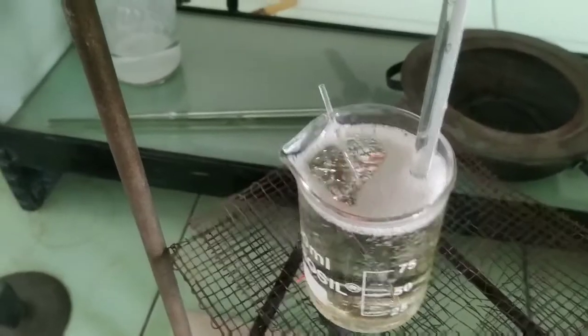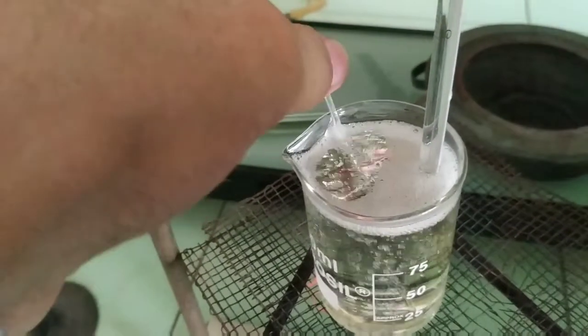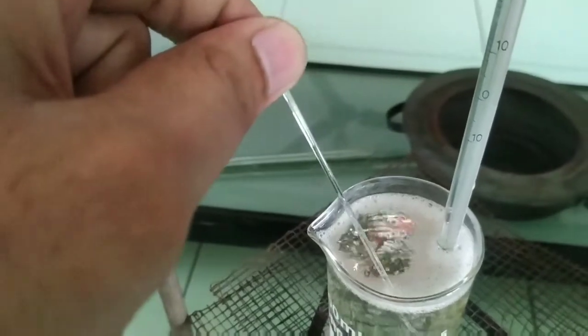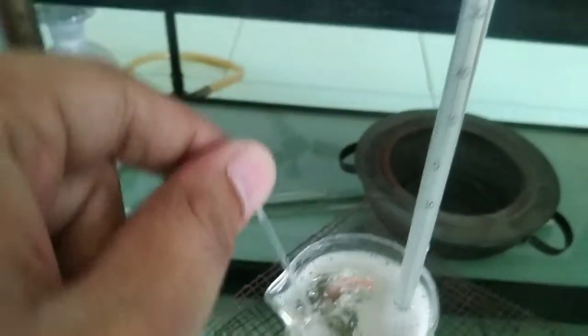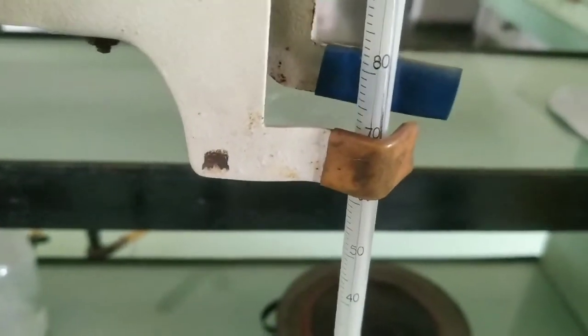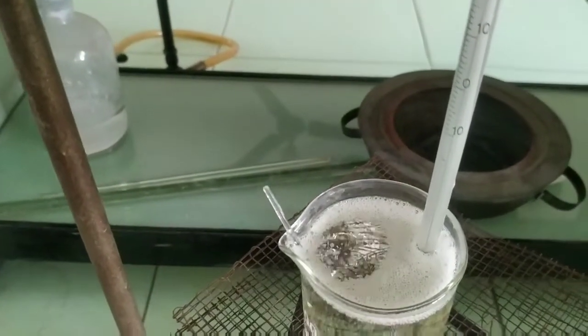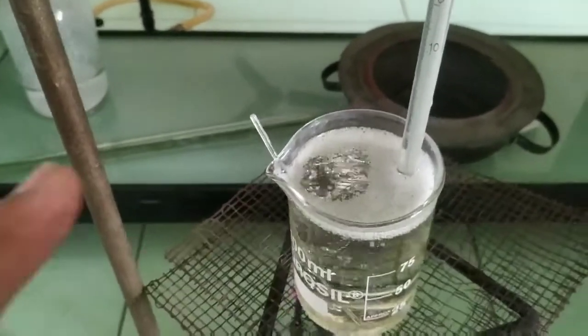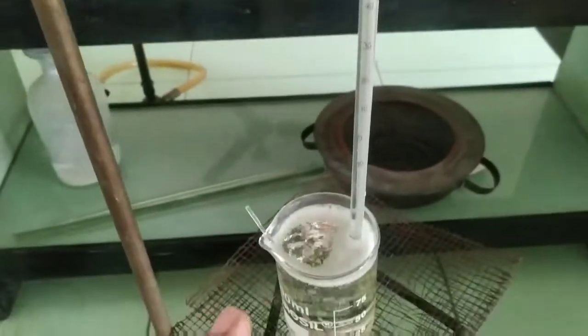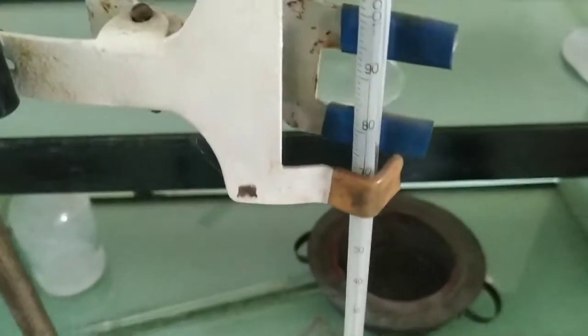Students, you can check here — the salt has totally melted. At that point we check what the temperature is. The temperature is 114 degrees Celsius. So this is the melting point of the acetanilide. We have to check carefully when the salt melts and at that time check the thermometer. The acetanilide melts at 114 degrees Celsius. Thank you.